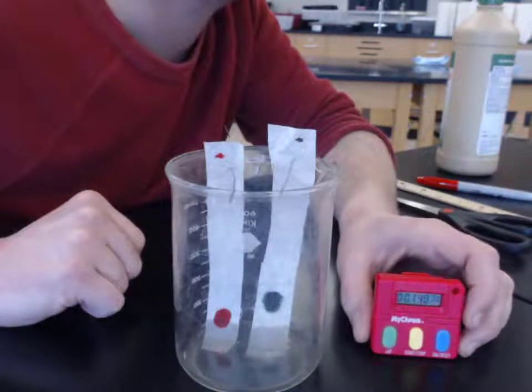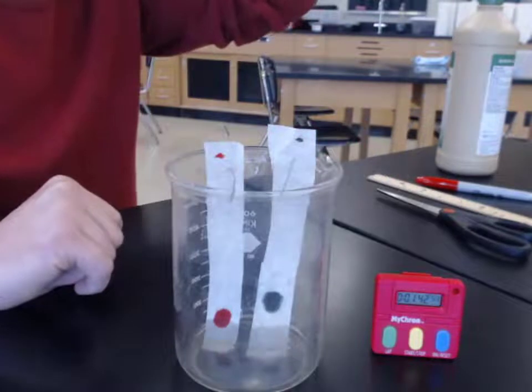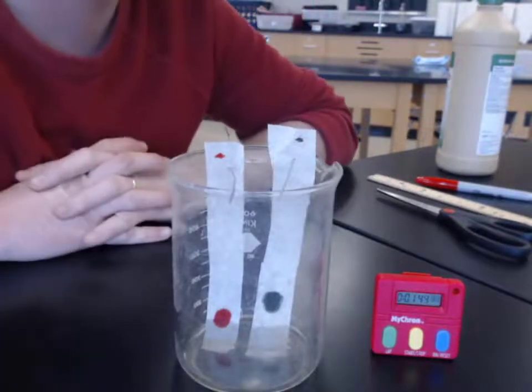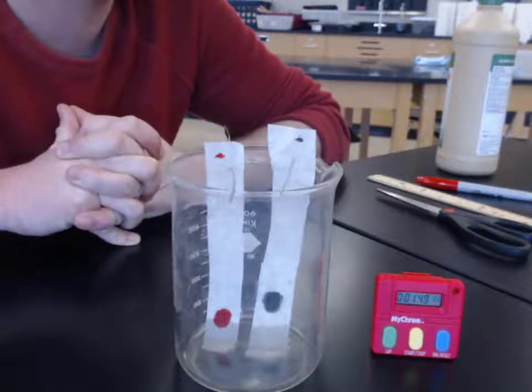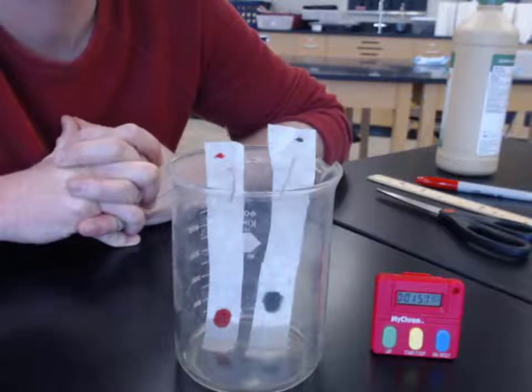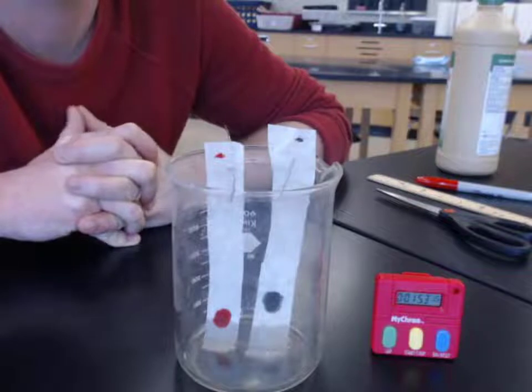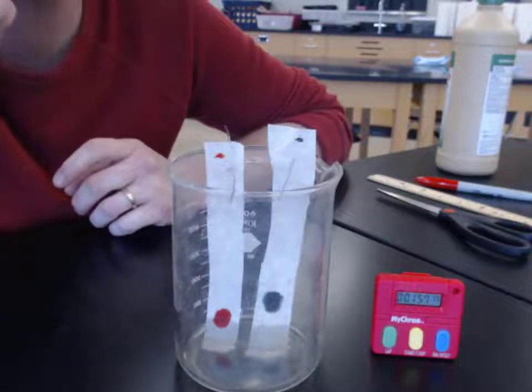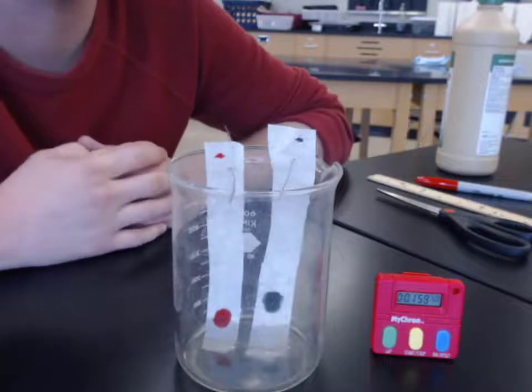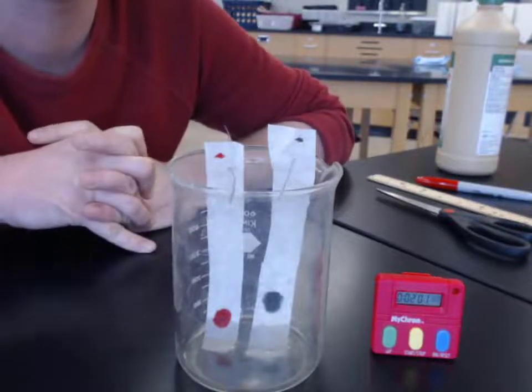You're probably just going to have to end up putting that as a digital timer on the screen. And then with that new time stamp for your next observation, you can draw a little sketch. What does it look like now? Make sure the time's on there. And then also provide a couple of phrases. Describe with words what you see happening the next time you write an observation. We want at least 5 of those as we're going along.